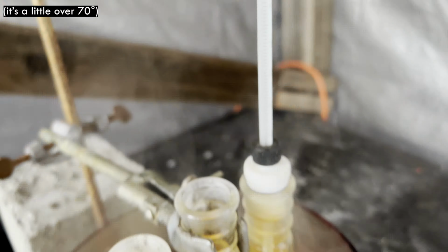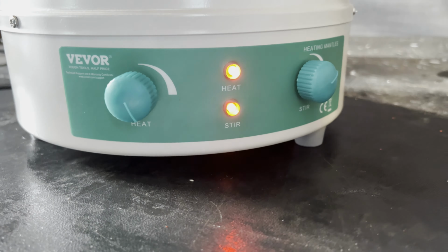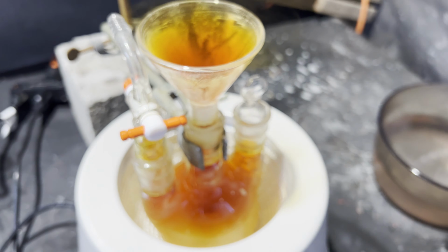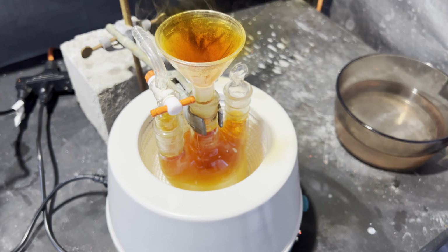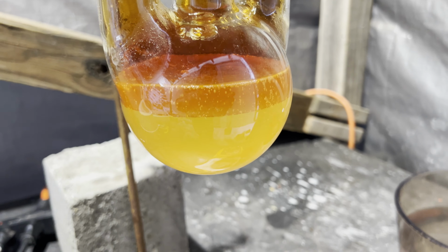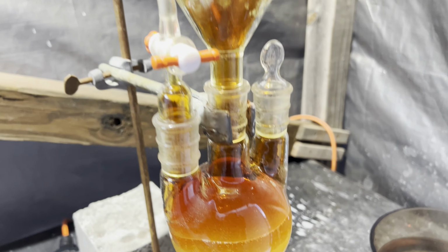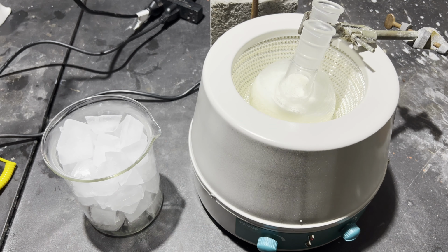The procedure says to heat the mixture until an oily layer forms on top, so I did that. I left the funnel on and stoppered the other necks because I figured it would reflux and the rest of the benzoic acid and potassium nitrate mixture adhering to the funnel would drip down and my mechanical loss would be minimized. This worked, and of course a lot of nitrogen dioxide gas was evolved as it was heated.